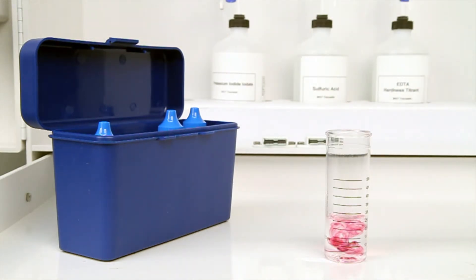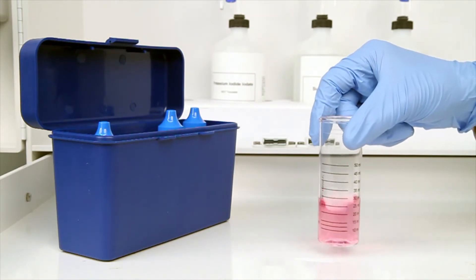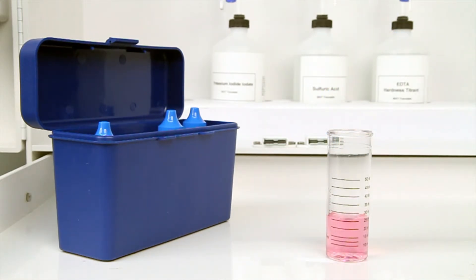In this case, the sample turned red, indicating that hardness is present. If the sample had turned blue, then no hardness is present and the titration is complete.